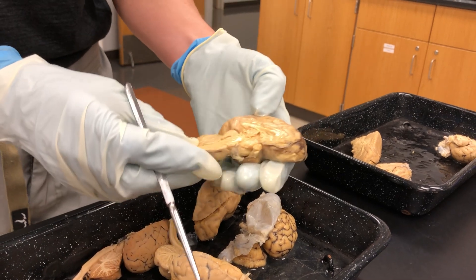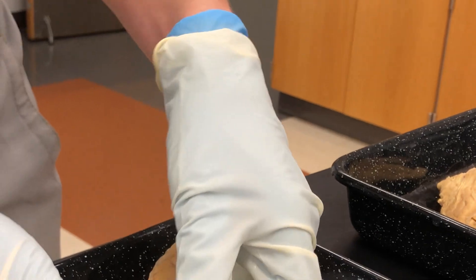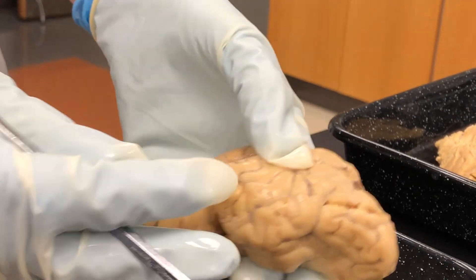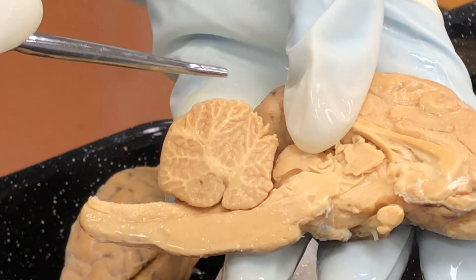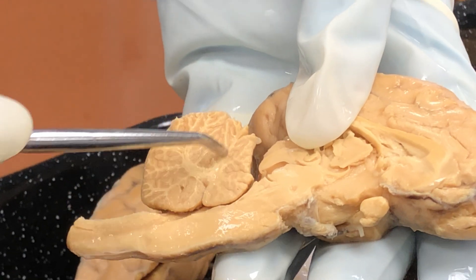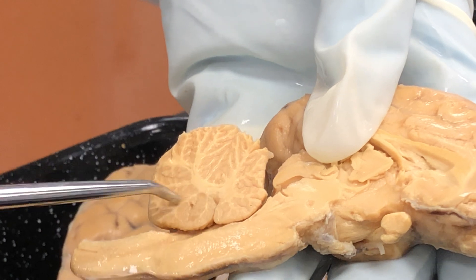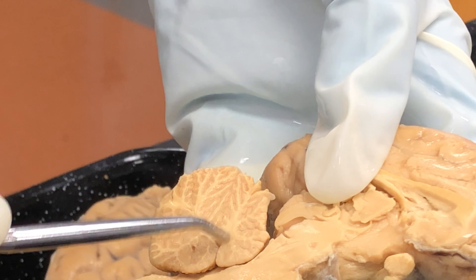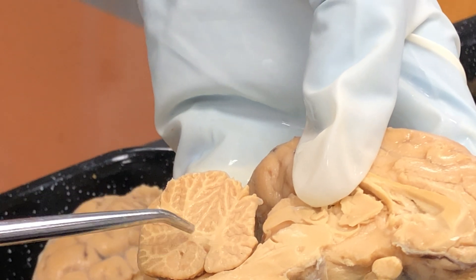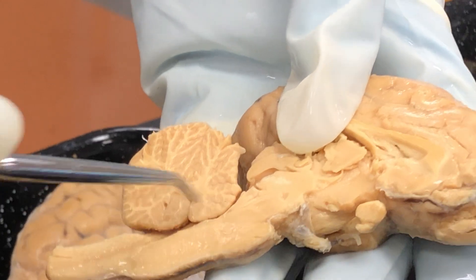Then we have the cerebellum. The cerebellum is the part right beneath the cerebrum, and it has these folds in it called folia. The cerebellum has gray matter along the outside along the cortex, but then you have this white matter part that looks like a tree with all these branches — it's called arborvitae, which is Latin for tree of life. All of this in here is white matter, and notice it's a paler color than the surrounding gray matter that lies over top of it.